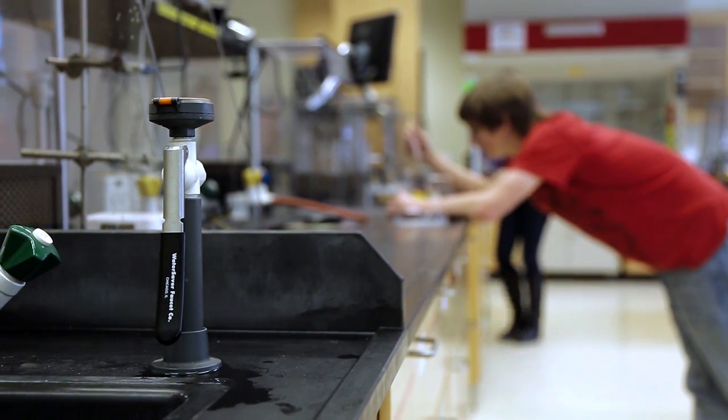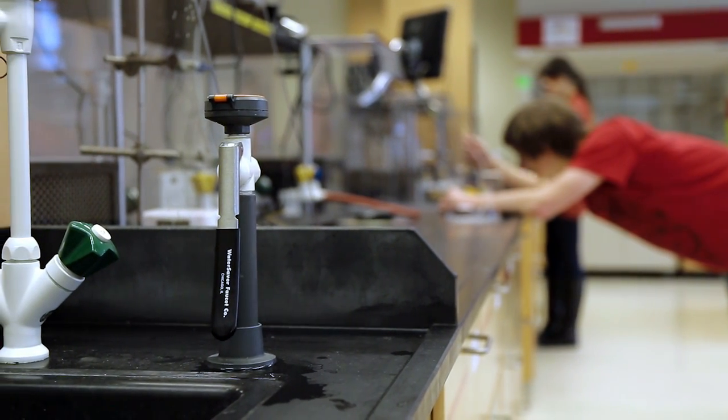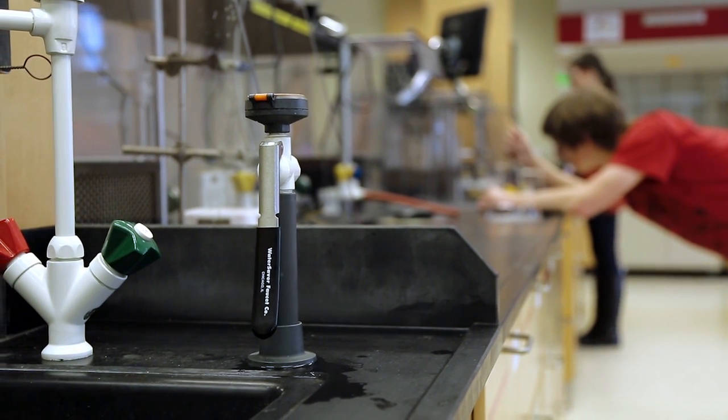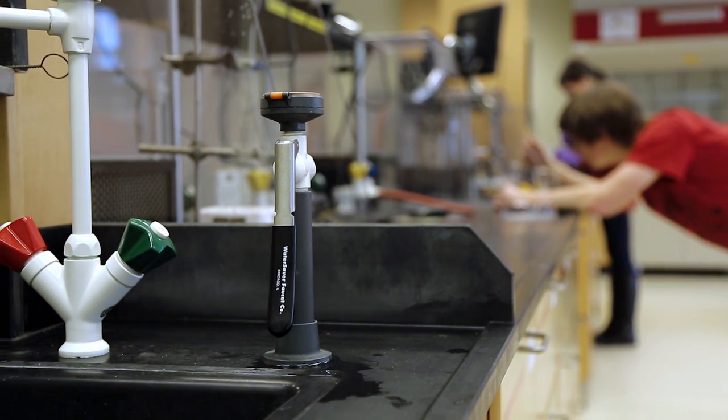If an accident occurs where dangerous chemicals are spilled or splashed into the eyes or onto the skin, it is critical to be able to wash the affected area as quickly as possible.